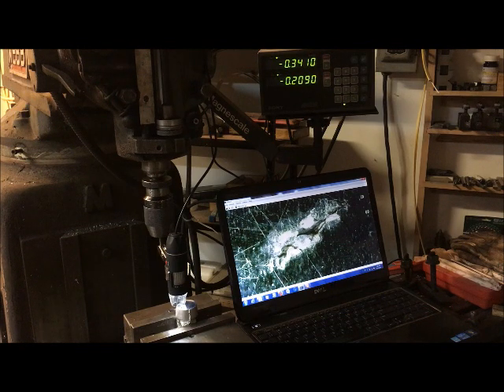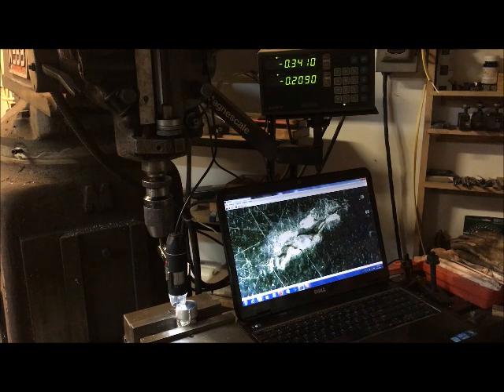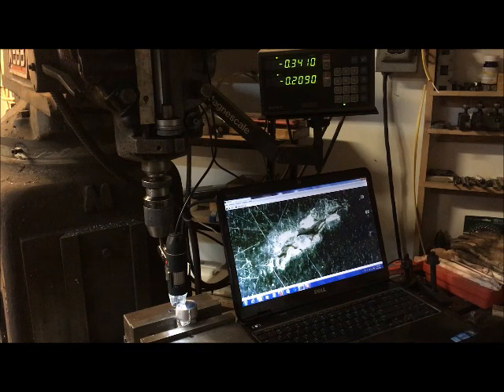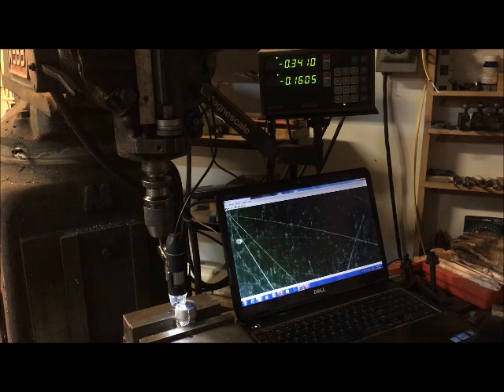Okay, now while y'all were napping, I went and looked at another defect, and I'll show you. Basically, it's a pretty small field of view, about 44 thousandths wide. So I scroll all the way across a piece, jump over the width of the screen, and scroll all the way back. And it takes a little while, but you'll get there. This is polished with diamond polishing, and I believe those are bits of diamond there. They didn't show up till I started doing the diamond. So I zeroed on the new defect, we're 341 thousandths by 209 thousandths off. But as you scroll, you can actually scroll pretty fast and see a defect.